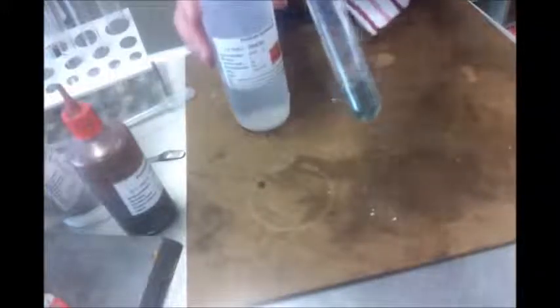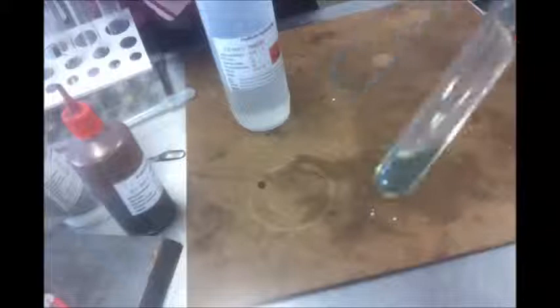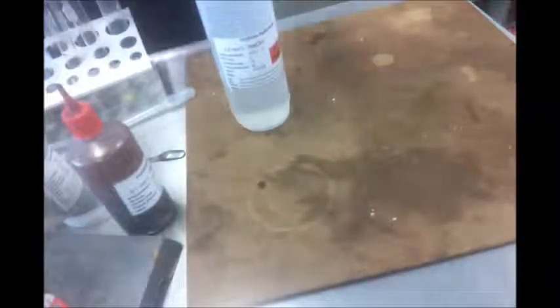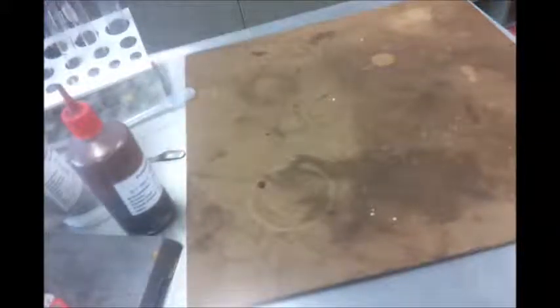And it's gone green. So that means the iron metal has turned into iron 2+. Because it was sulfuric acid I made, it was probably iron 2 sulfate that I made in there. Alright. So, we know that we've had reactions in these. We're going to prove shortly that they are oxidation reduction. There's one more I want to do just to show you.